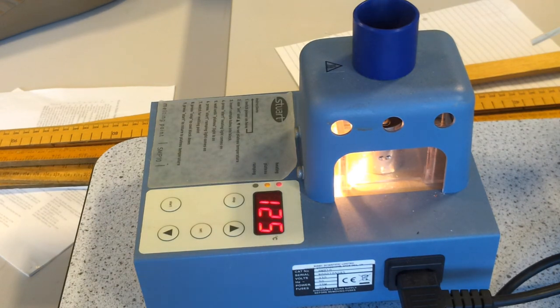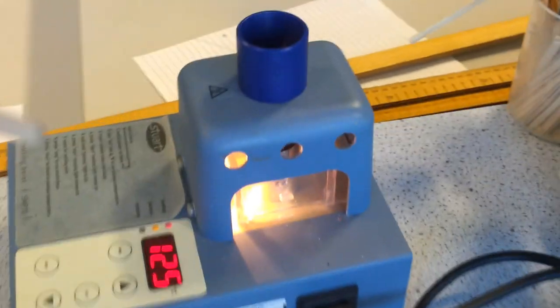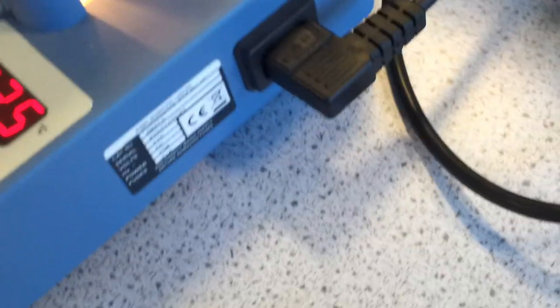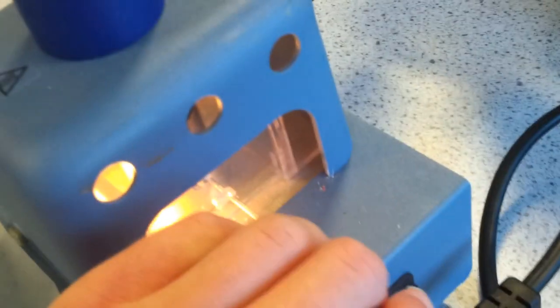Next we need to place it into the contraption, so it's going to go in through the little side door and into the heating chamber.